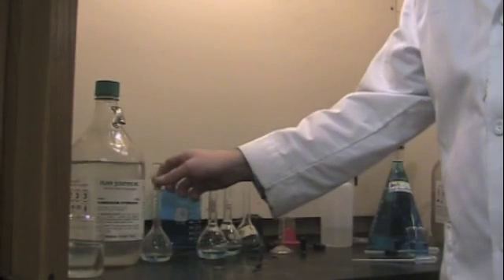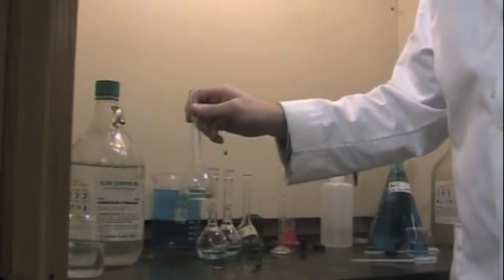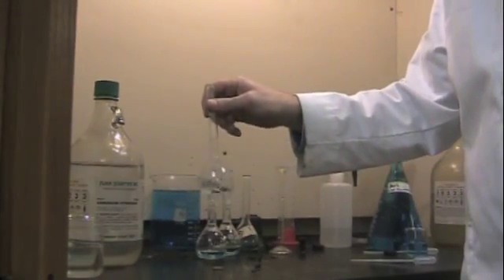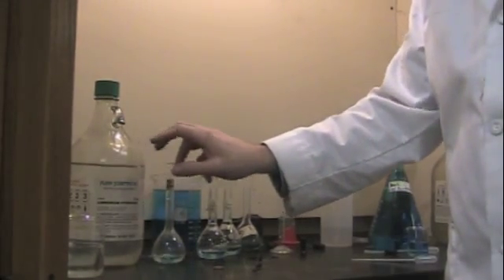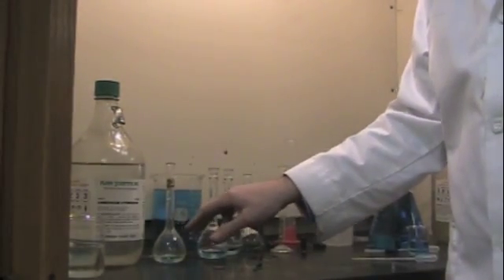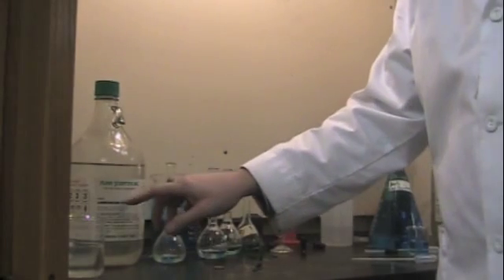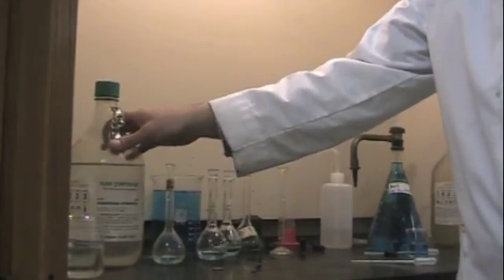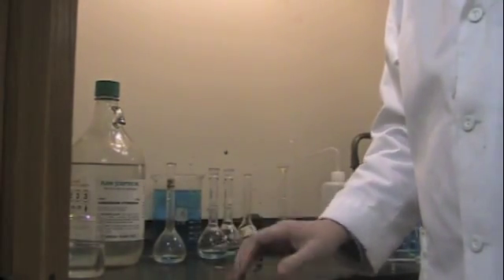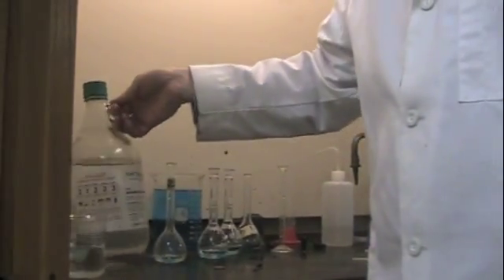To our known solutions, as you can see they're pretty light blue. And what the ammonium hydroxide does is it makes it darker blue so the spec 20s can pick them up. Anyway, we need to add this. It's very strong stuff, it's around 15 molar, so you don't want to touch it, you don't want to get it on your hands, and you don't want to breathe it because it smells really bad. It's a very strong ammonia smell.